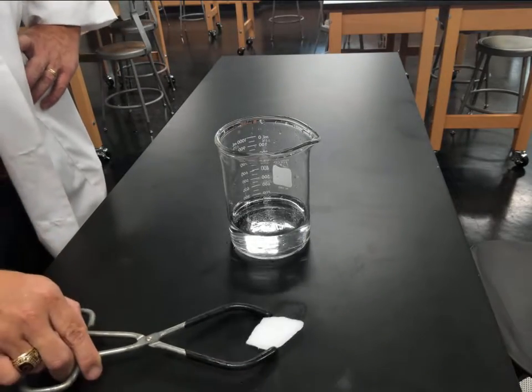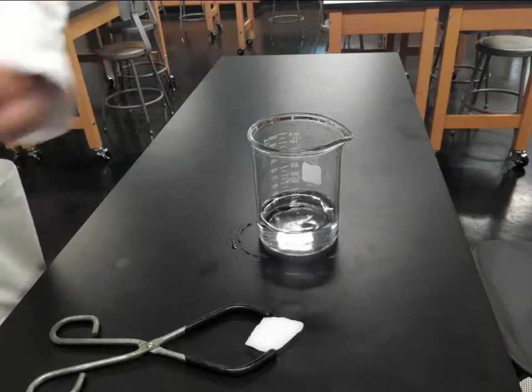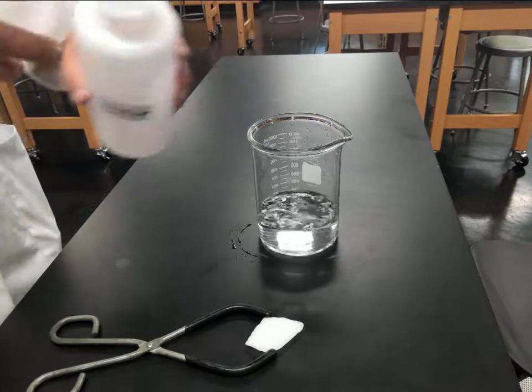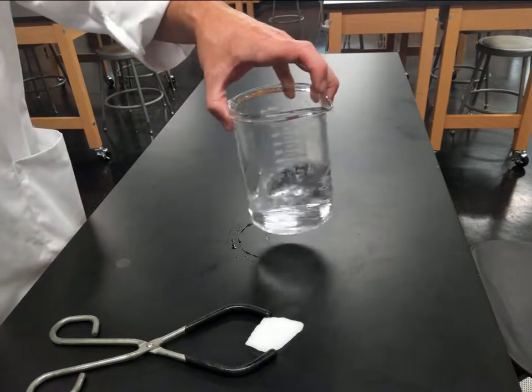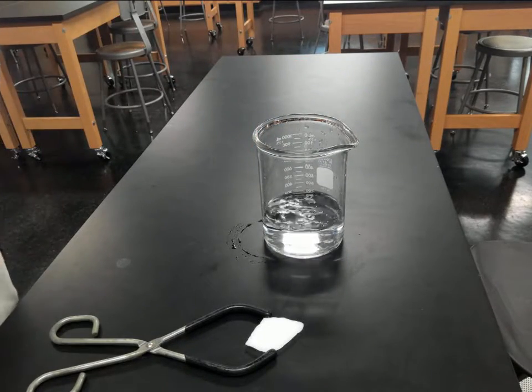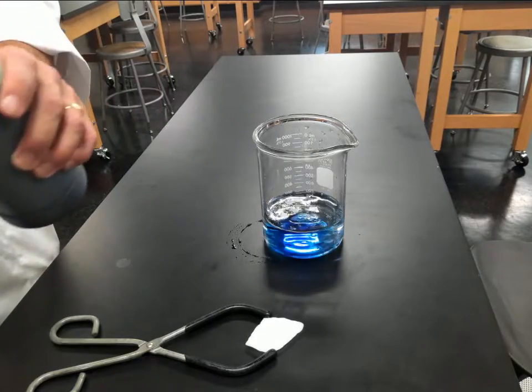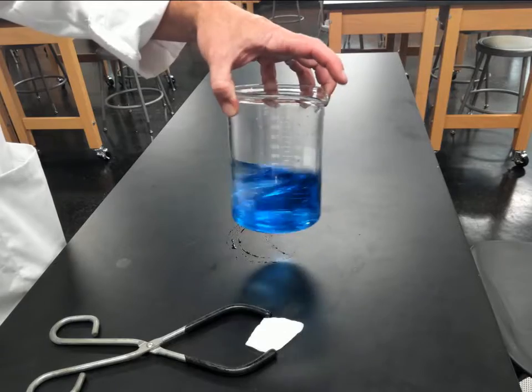So what I'm going to do now is take some water that I have in a beaker, and I'm going to add a little bit of sodium hydroxide, a strong base. Going to mix it up a little bit. And I'm now ready to add an indicator, some bromothymol blue. For bases, this is going to have a blue color, and acidic, this one is yellow. Notice we get our nice pretty blue color, indicative of having a base in solution.